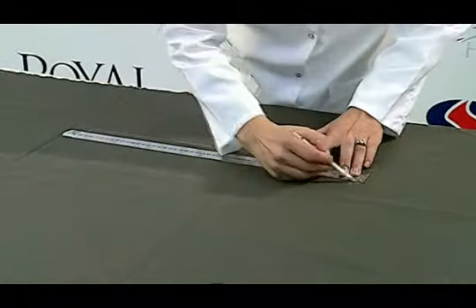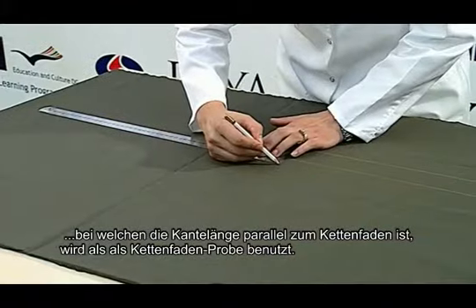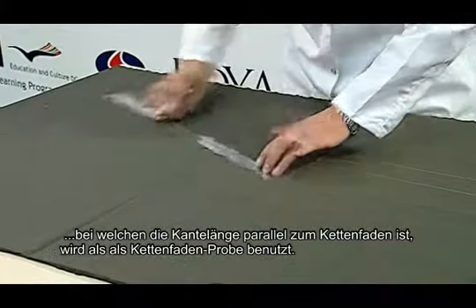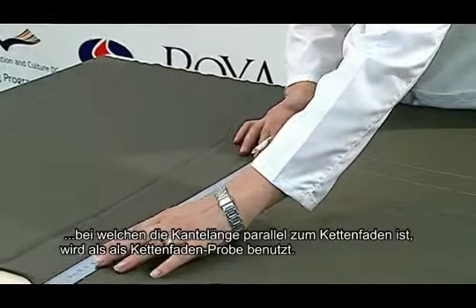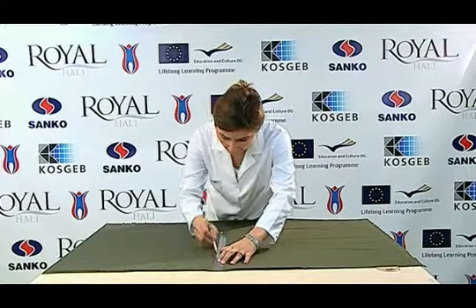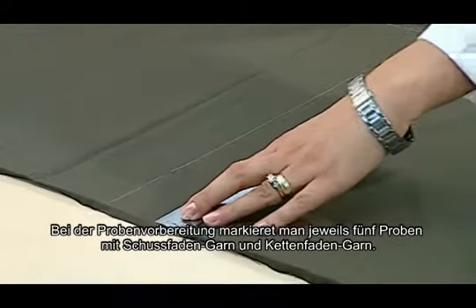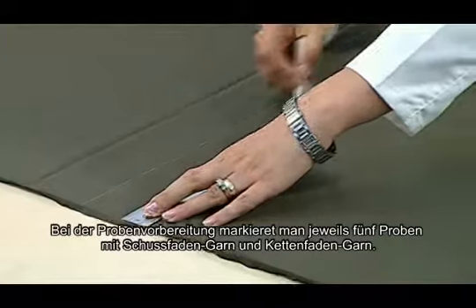Our sample parallel to the weft is used as a weft sample, and the sample whose long edge is parallel to the warp is used as a warp sample. While taking our samples, we mark 5 samples, each including different weft and warp yarns.